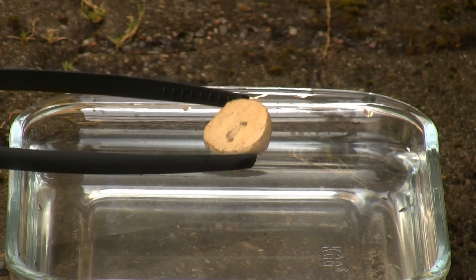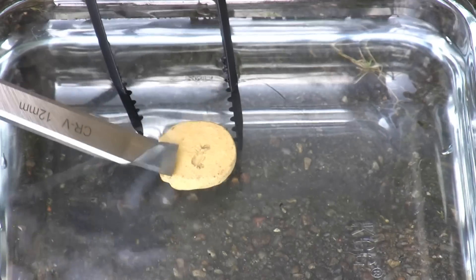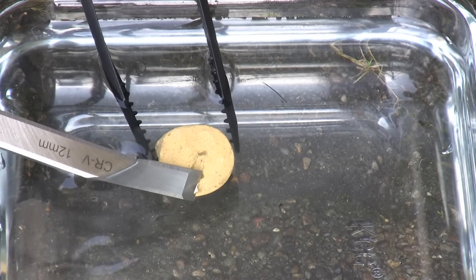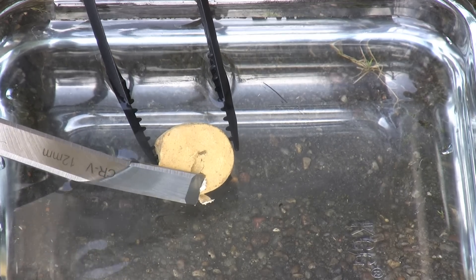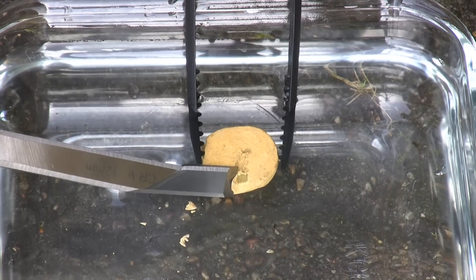Looks like this one is getting angrier. Let's move on. Here I scrape off the coating so you can better see the waxy white phosphorus. High purity white phosphorus is almost glass clear, but this is just a commercial grade yellow sample.